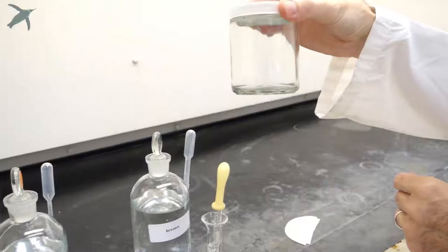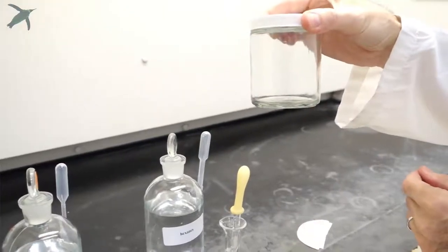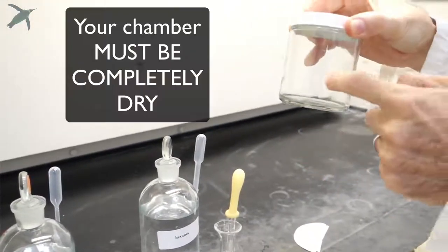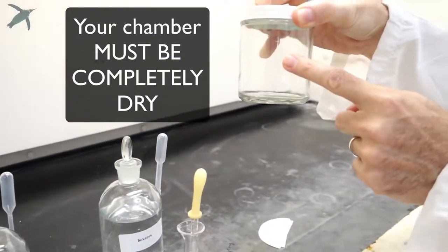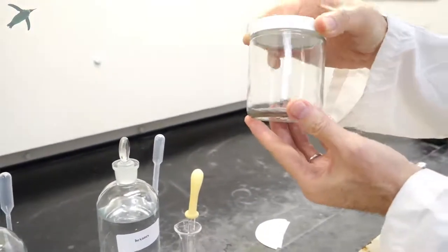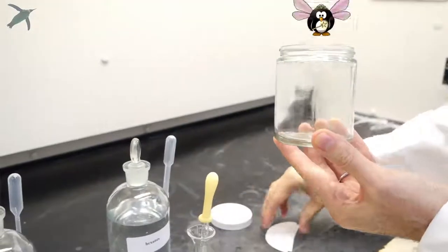Your TLC chamber will look something like that. It has to be clean and absolutely dry. No water can be in there.